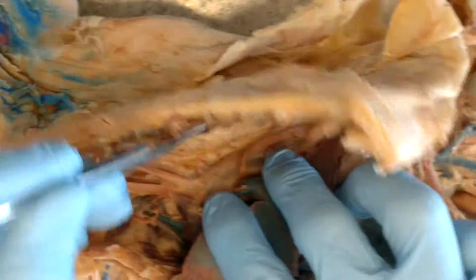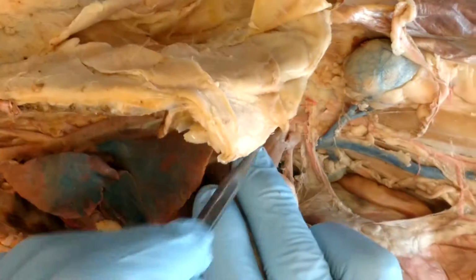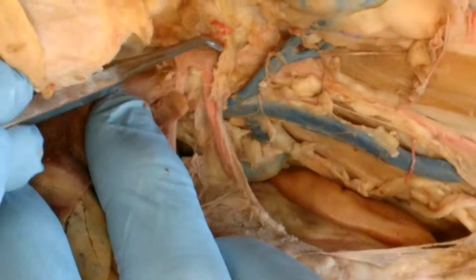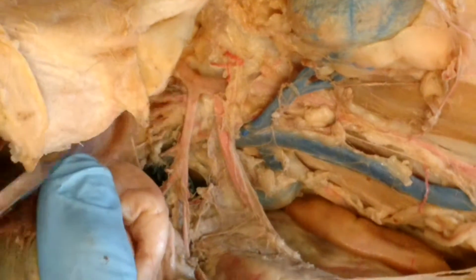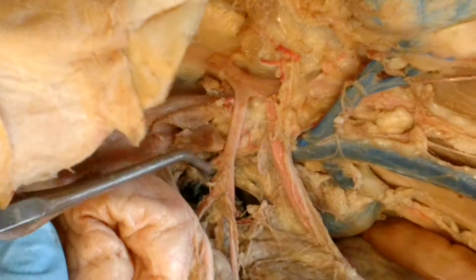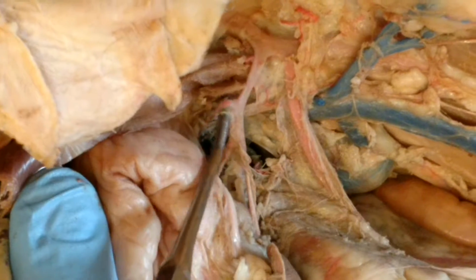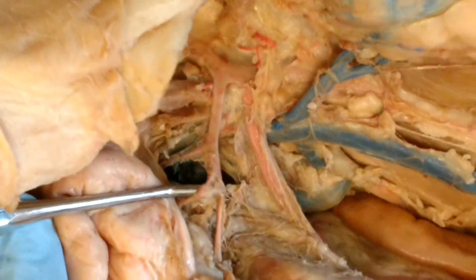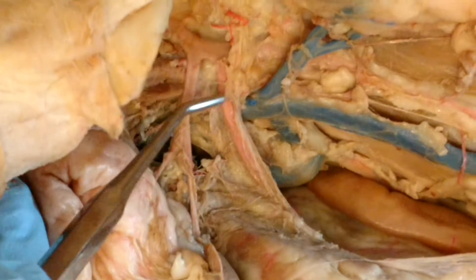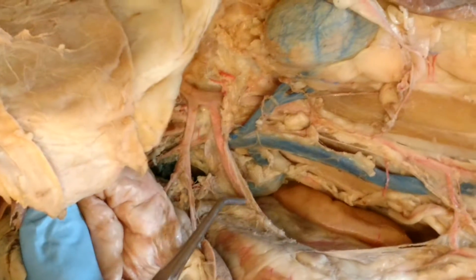So then let's follow the aorta. This is the descending thoracic aorta. All right, when we come down here, when it hits the diaphragm, it becomes the abdominal aorta. The first branch off of the abdominal aorta here is the celiac trunk. And then branching off the celiac trunk is your common hepatic artery there, which is going to go to your liver. This is your left gastric artery going to your stomach, and this is the splenic artery, which goes over to your spleen. The next branch off of the aorta here is the superior mesenteric artery.